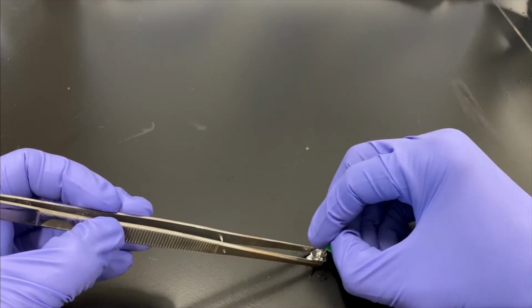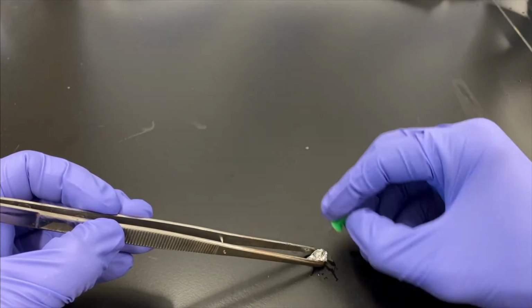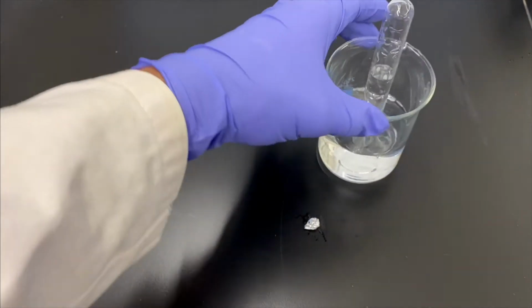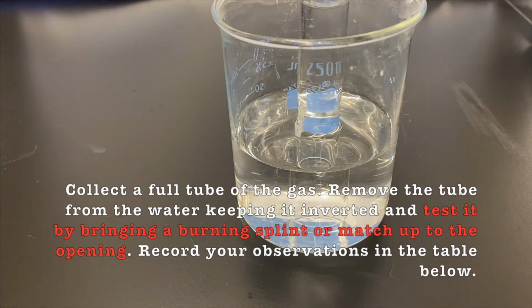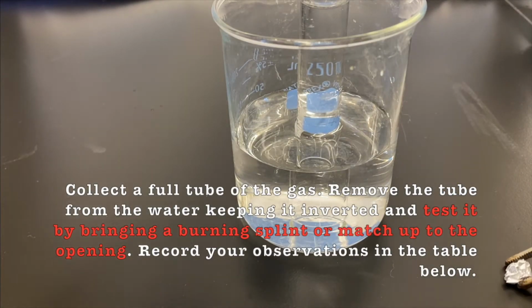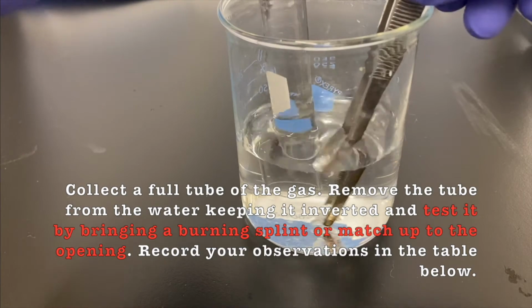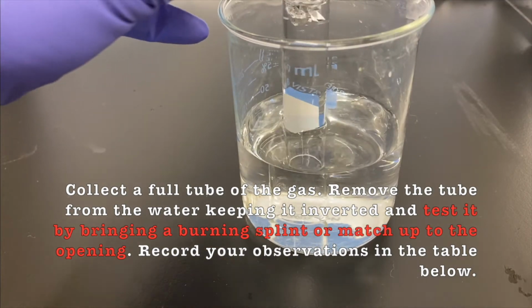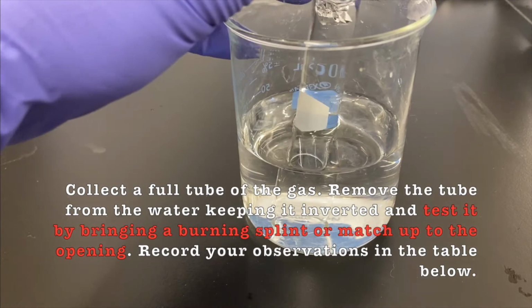So sodium, if you just put it in water and you get a huge flame, do you think it's more or less reactive than calcium? I would say more. More, yeah. Calcium didn't just catch on fire spontaneously. And you can see why we put the water in the test tube like that. It helps just keep it up and float to the top.